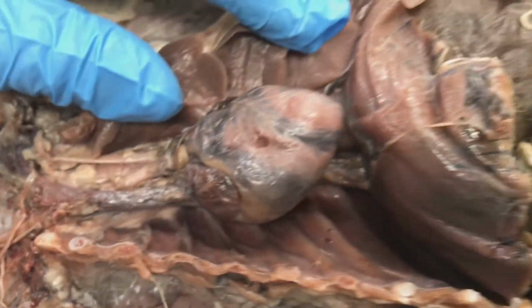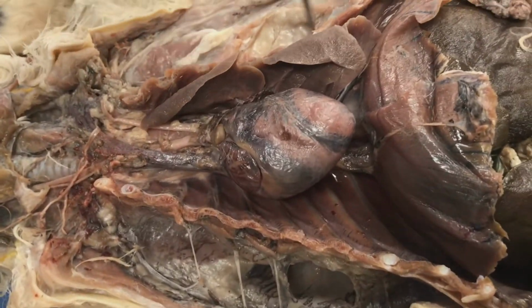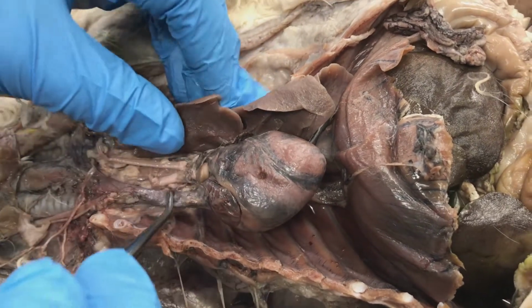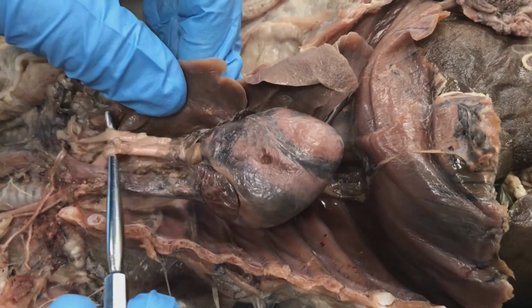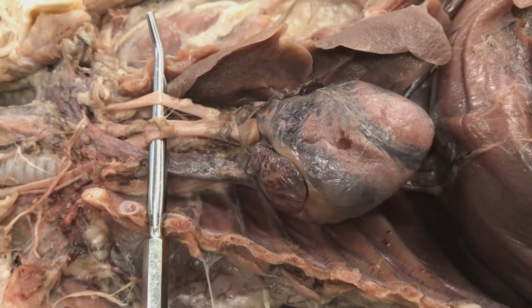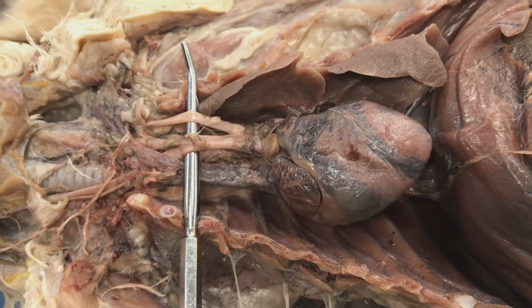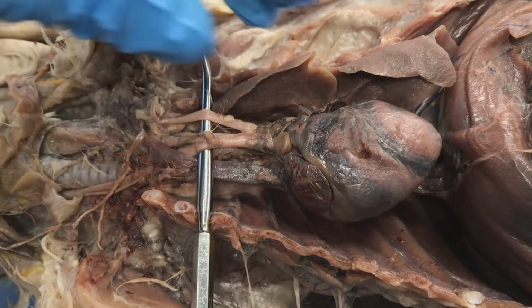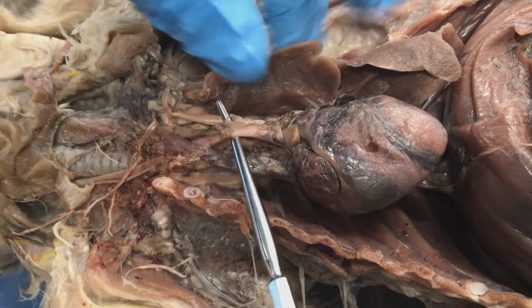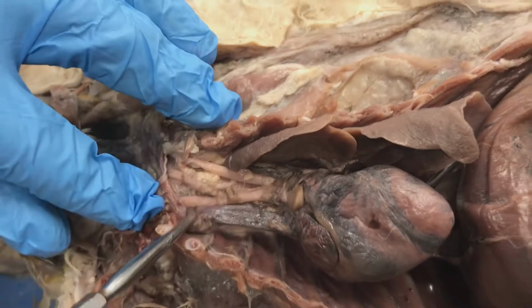On the arterial end, your aorta is going to arch. It's going to start from the top. It's going to curve around and then hug the base of the spine, giving off several branches. Now, in the case of humans, we have 3 large branches coming off the aorta. It starts out with the brachiocephalic artery, and then the left carotid and the left subclavian on the left side. On cats, they just have the 2 main branches. So on this side, they see the brachiocephalic artery, which immediately branches into 3 individual branches here.